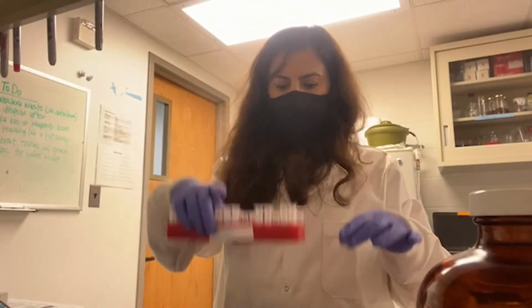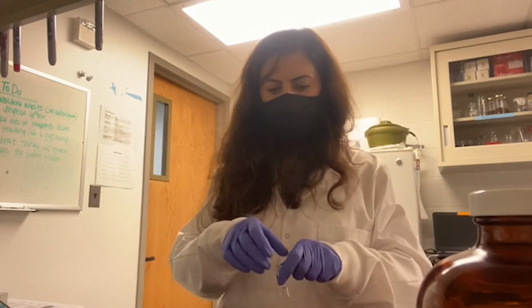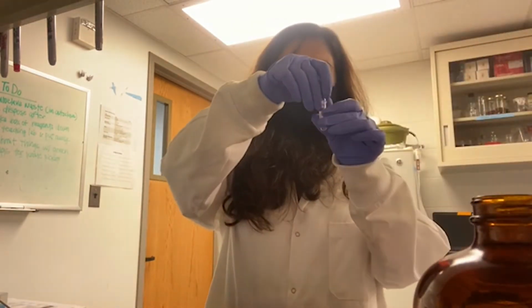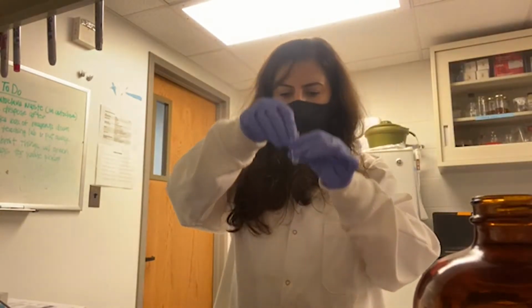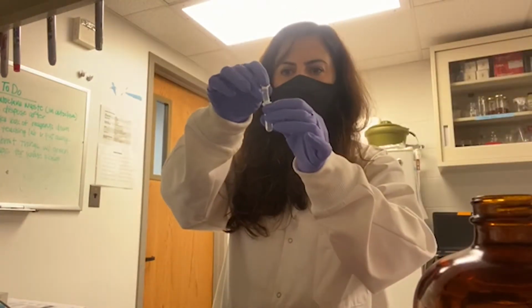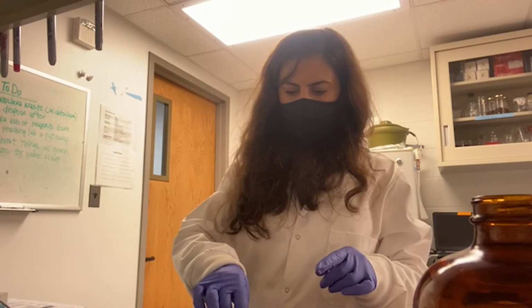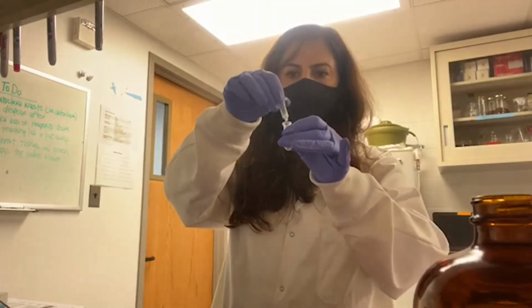Yes, as I said, our sample is centrifuged through the columns. Now I'm going to discard the flow through and keep the column for each of them, because I'm going to load the rest of my sample here, and this column is holding my RNA. RNA is attached to this column.